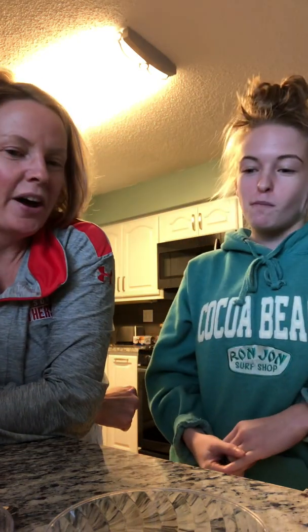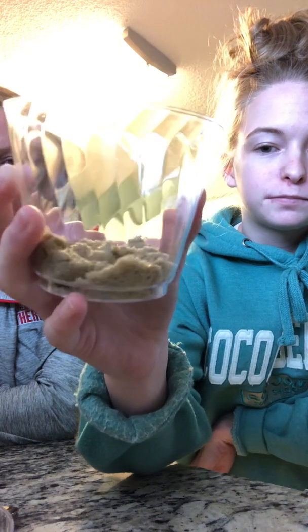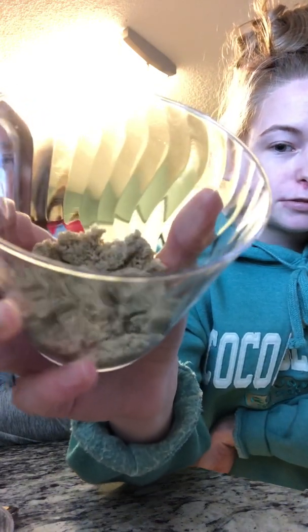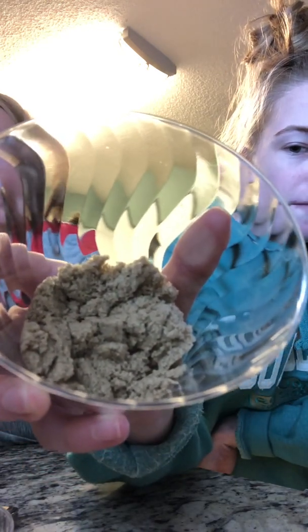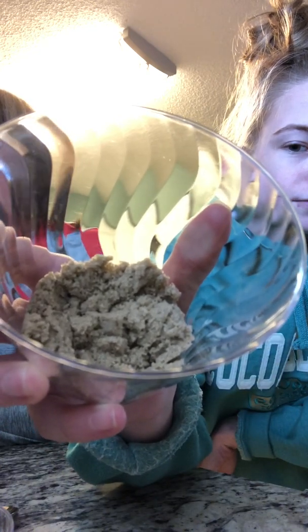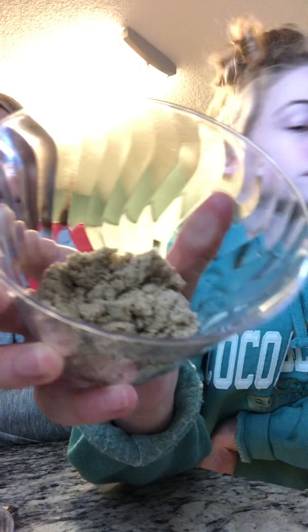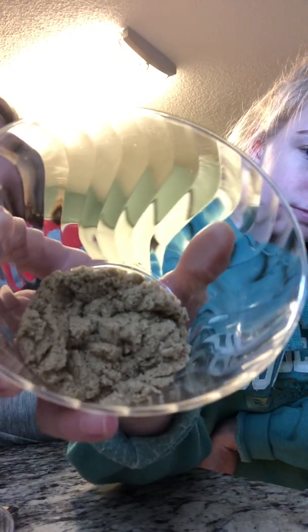So Emma, hold up the cup of sand to the video. All right, so boys and girls, you have all, I'm sure, played with sand in your lifetime. So just take a peek to see what the sand looks like, and think about the times that you have played with sand before. And on your lab sheet, you are going to describe the physical properties of sand. So think about what it looks like, maybe the color, the texture, how does it feel, maybe how does it even smell. So what sand physically looks like.